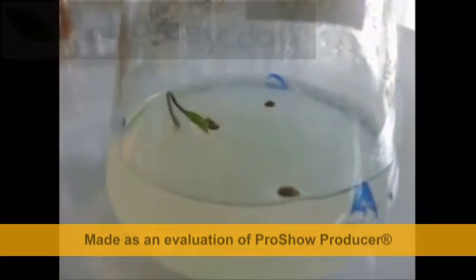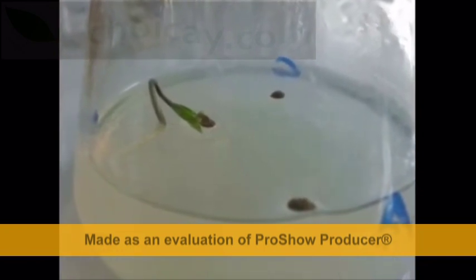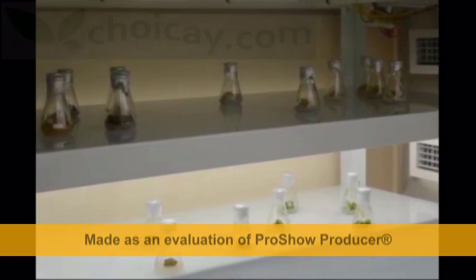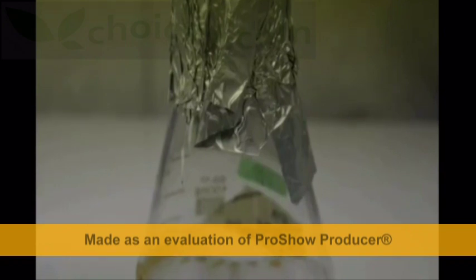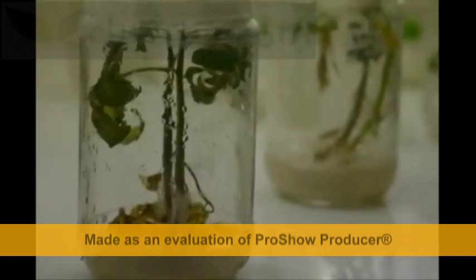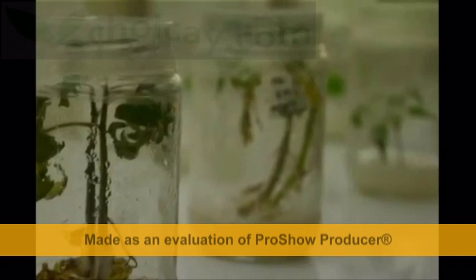Seeds are then inoculated into a conical flask containing the media. The flask containing the seeds is incubated in a well-lit area. After some period of incubation, seed germination is to be expected. Further observation can be made on the morphology of the plant after a few weeks, ensuring it is ready for hardening.